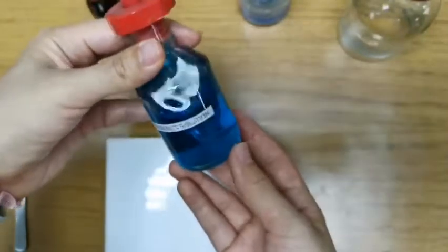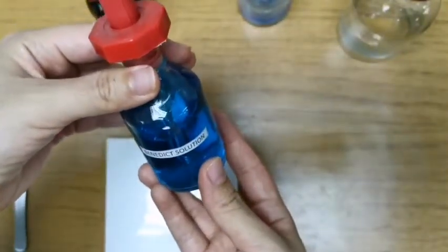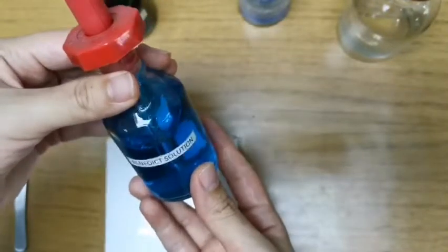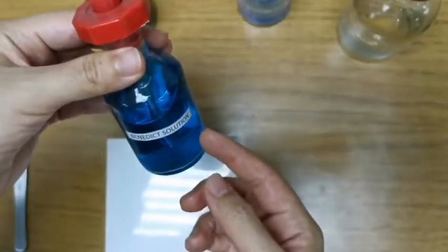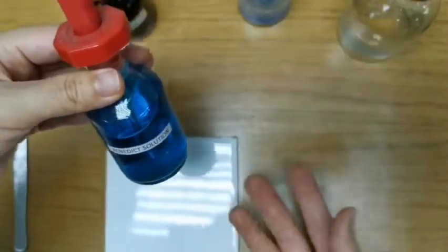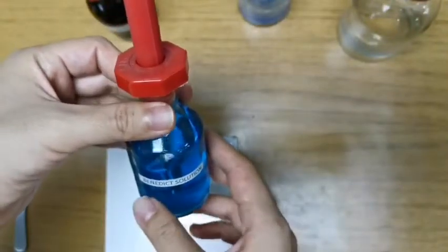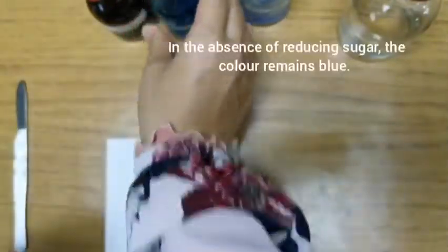You can see that it is blue in color. In the presence of reducing sugar, after we conduct the test, this blue color will turn either yellow, orange, red, or green. If reducing sugar is absent, then the color just remains blue.